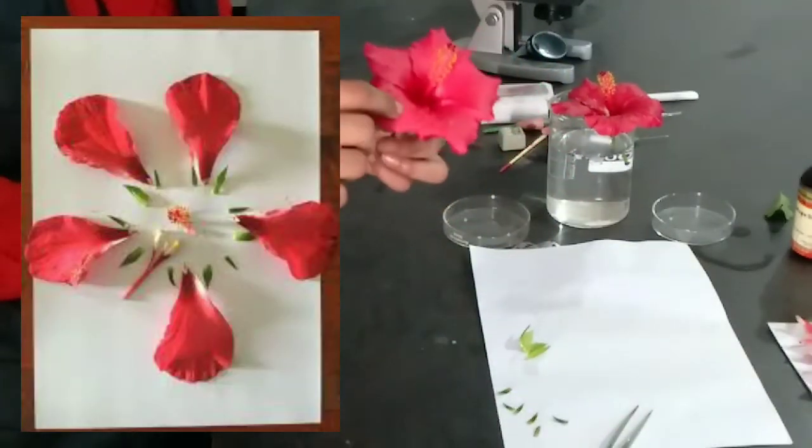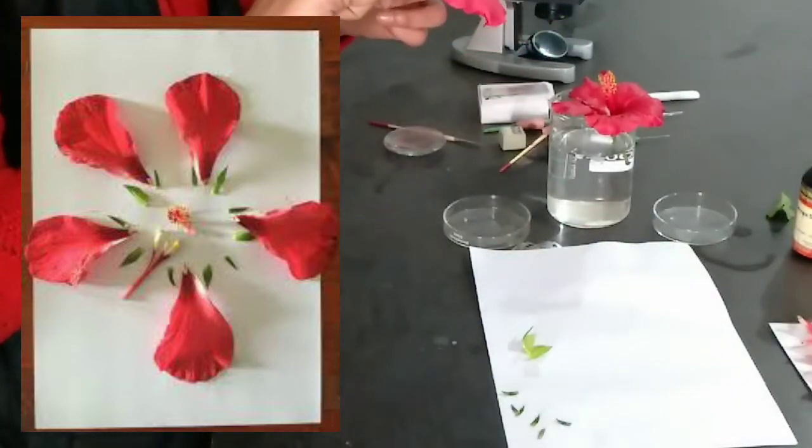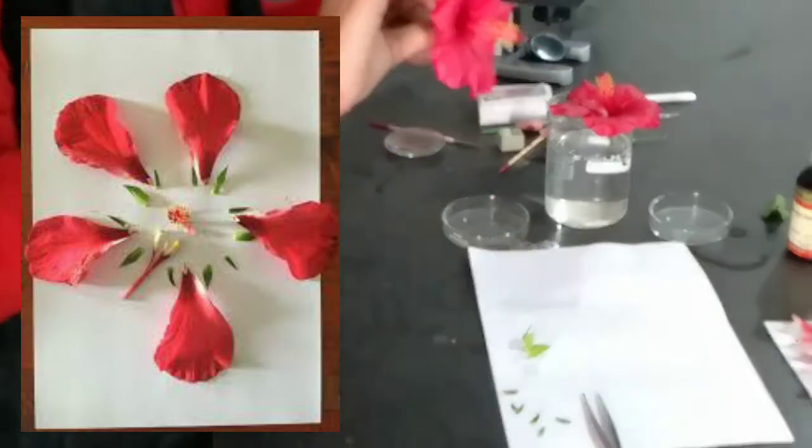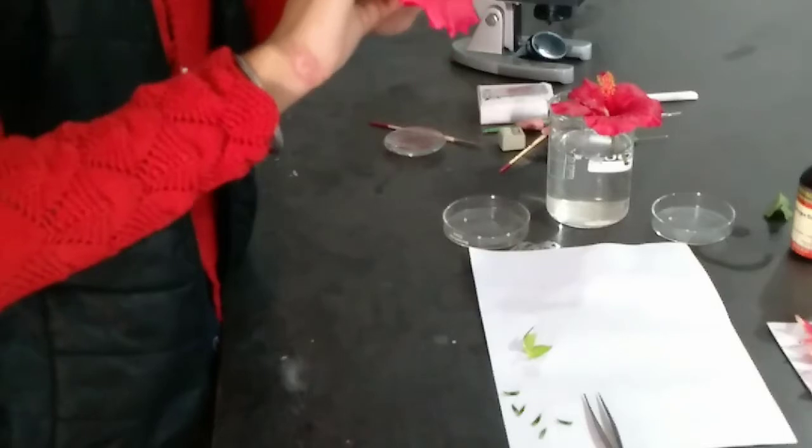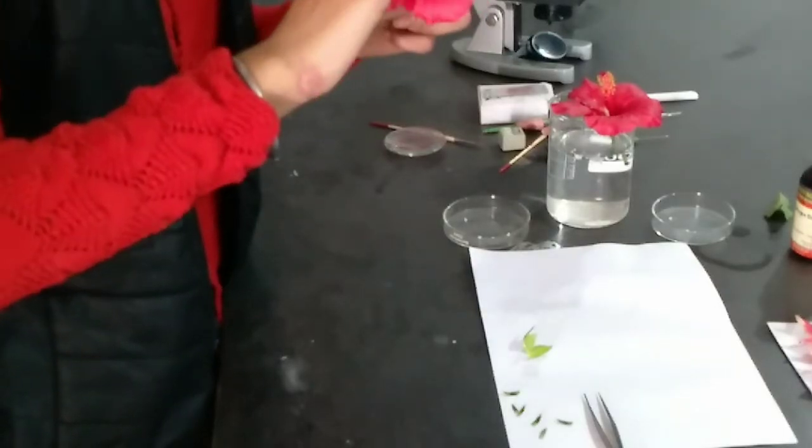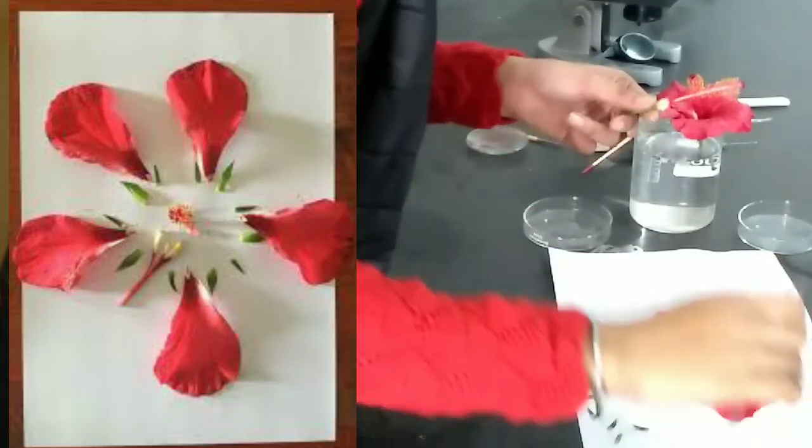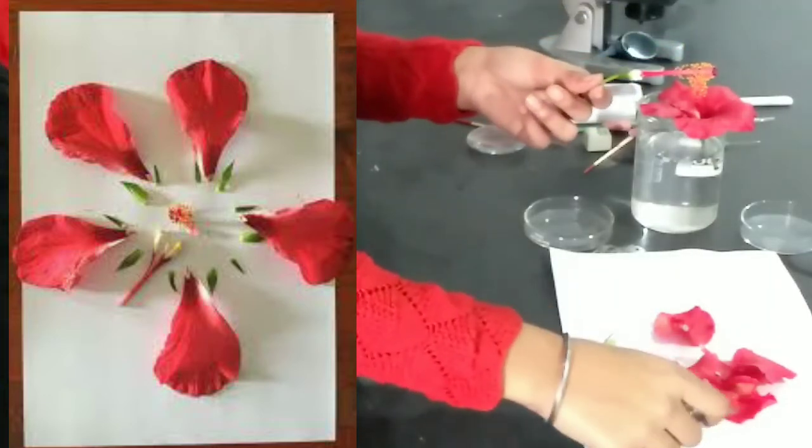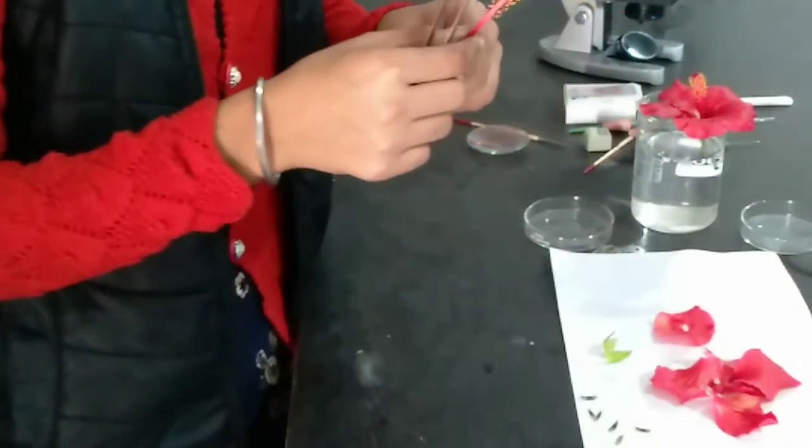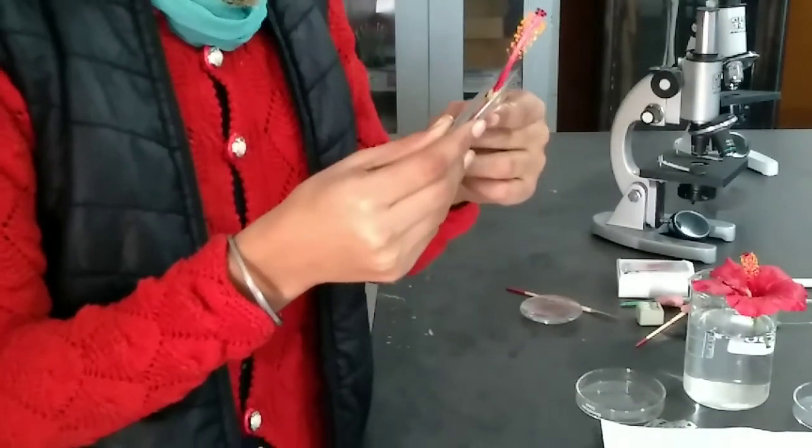Now these are the petals. Now we are going to remove the anthers and the stamens.